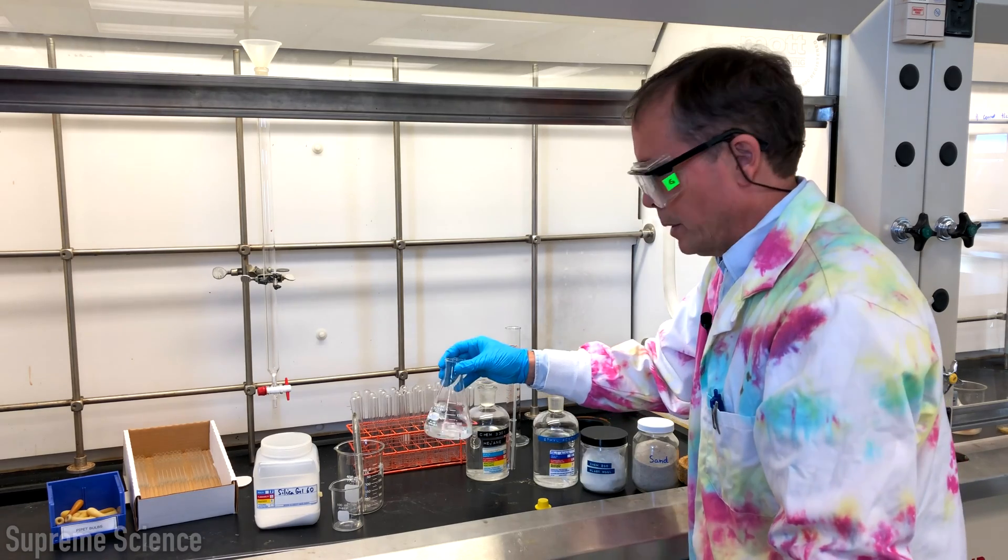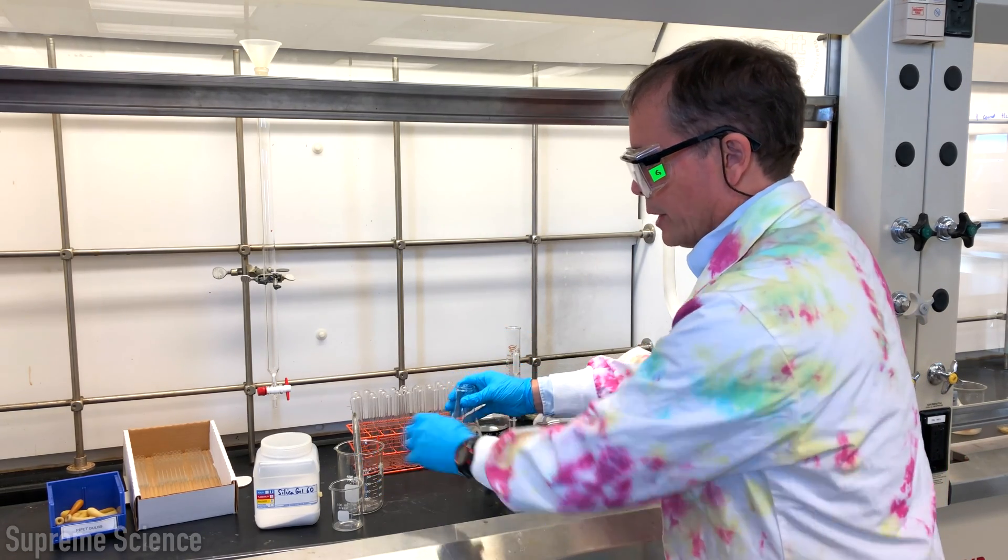We now have our two to one mixture of eluent made up and we can make the slurry now in the beaker.